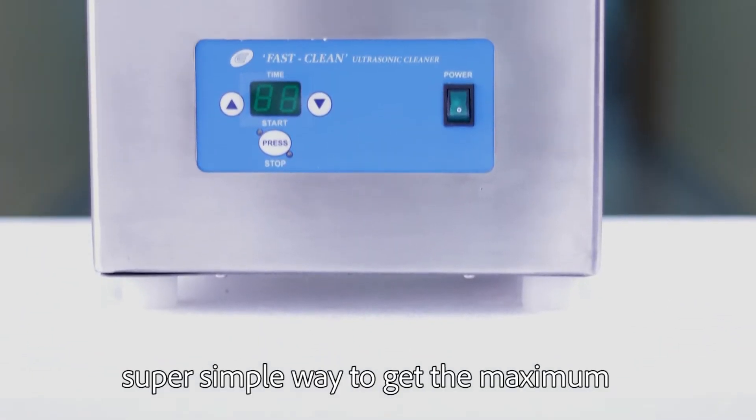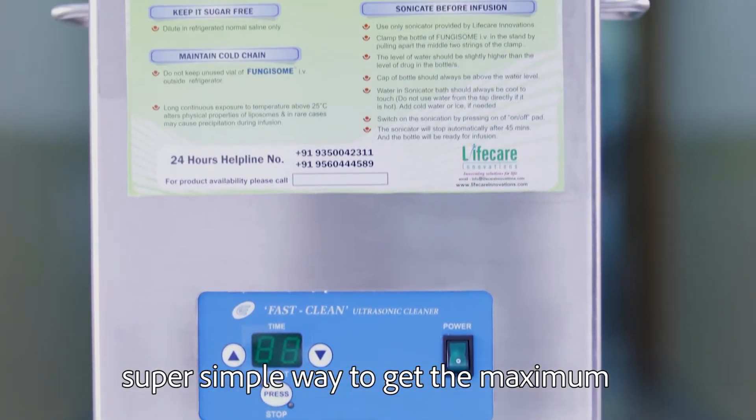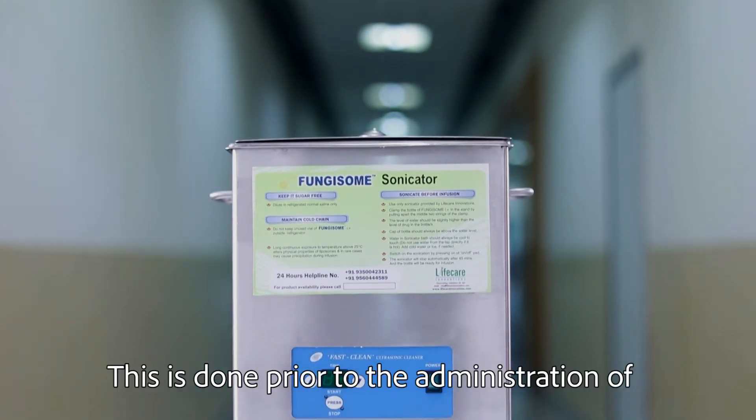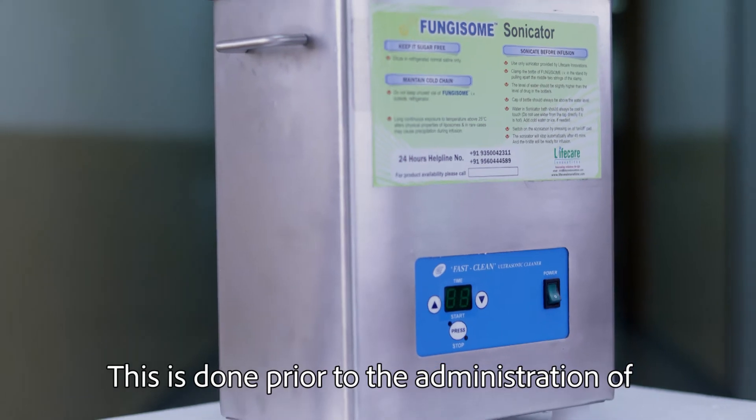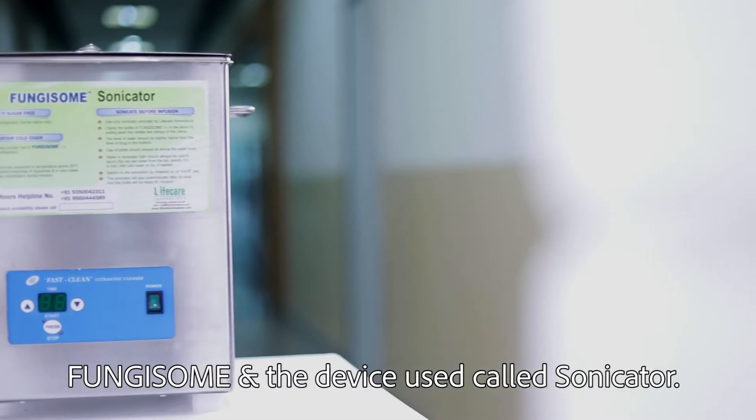Sonication is a user-friendly, super simple way to get the maximum benefit from Fungisome. This is done prior to administration of Fungisome using a device called a Sonicator.